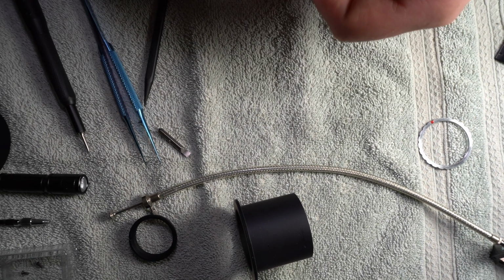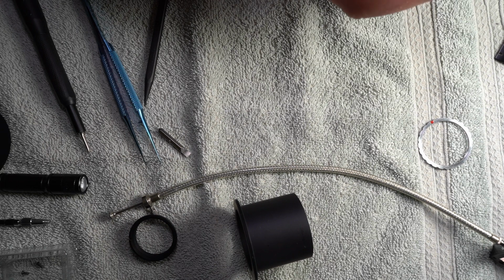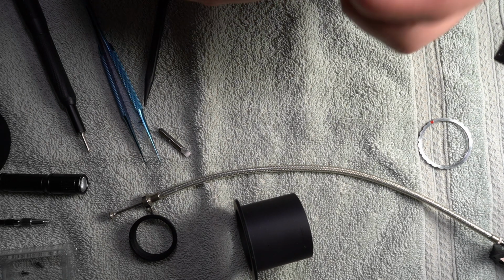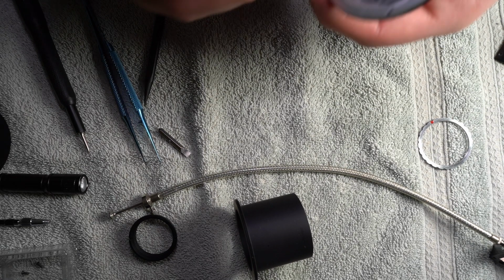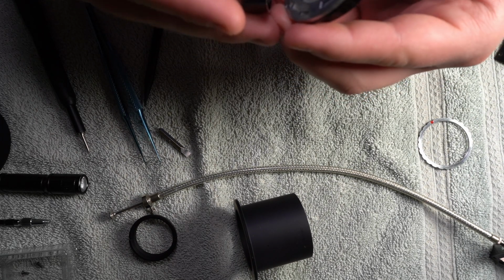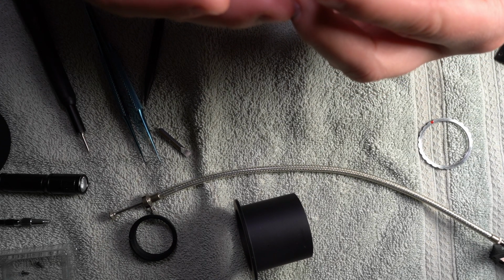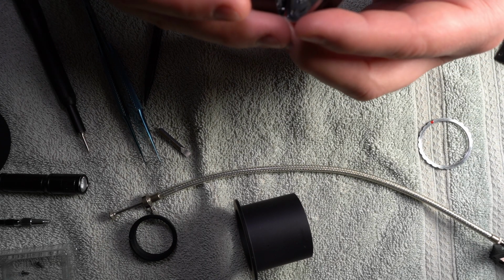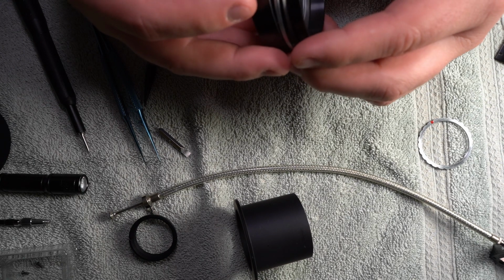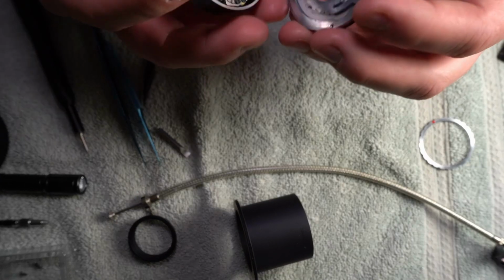Gotta be like that, maybe? That can't be that far off. It's gotta be something. Yeah, it does that. I don't know what it does. There's no way to get that thing to go, right?